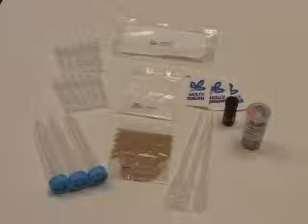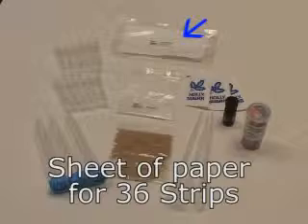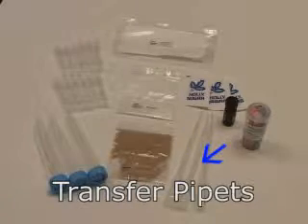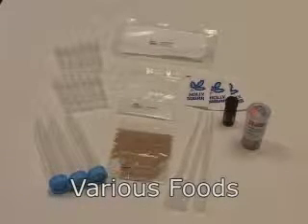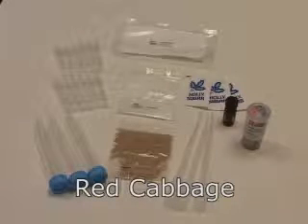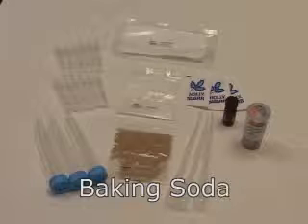Your kit should include dry yeast, starch, sugar, iodine solution, a sheet of filter paper for 36 strips, litmus paper, large test tubes, small test tubes, calibrated transfer pipettes, wooden applicator sticks, and small spoons. You will also need foods such as a potato, apple, banana, cheese, or bread, 3% hydrogen peroxide, table vinegar, red cabbage, lemon juice, shampoo, and milk, gloves and goggles, scissors, and baking soda.